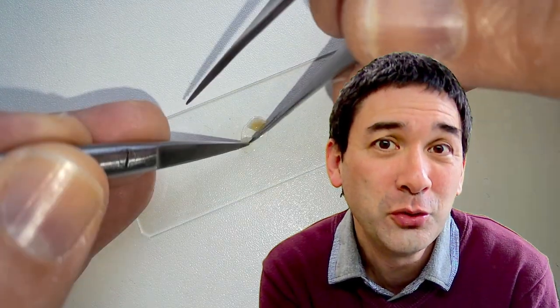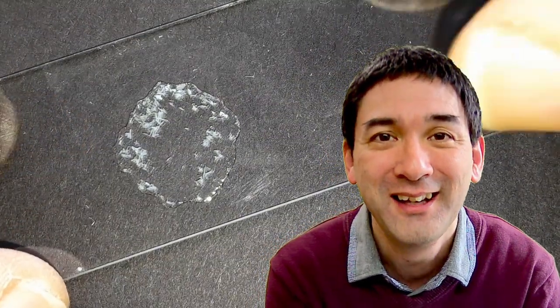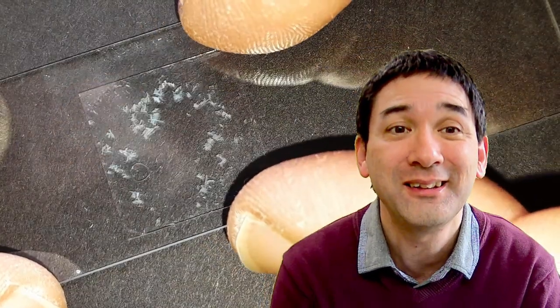Oliver is my name and I'm going to show you some of the structures that even the early microscopists of a few hundred years ago were able to see with their simple microscopes. And I think that their microscopes might not even have been that simple, considering the fact that the structures I'm going to show you today are quite delicate and small.